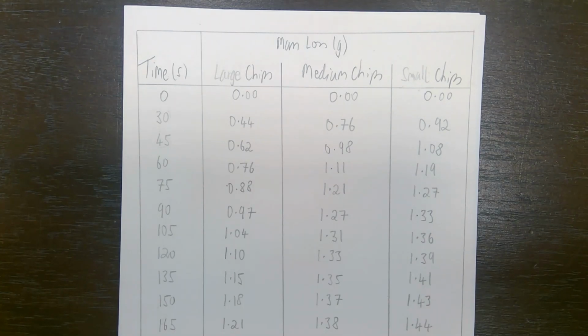I have titles at the top of the table that clearly show what the numbers mean. Next to each title, I have the units, so that I'll never forget what my numbers were measured in. Notice that I've been careful with the number of decimal places. The balance in the video associated with this video measures to 2 decimal places, and so I've been careful to use 2 decimal places throughout, including, notice, 0.00 at the top. That's commonly forgotten.